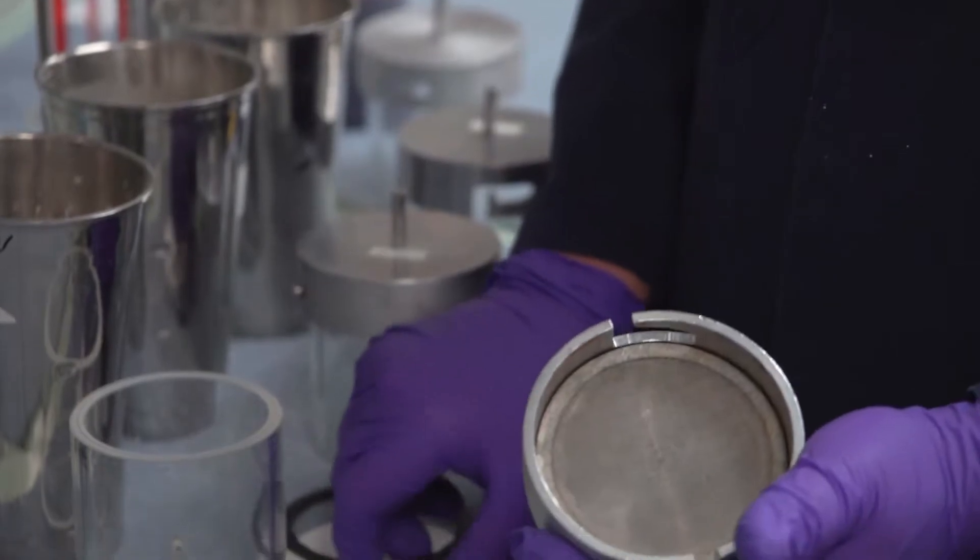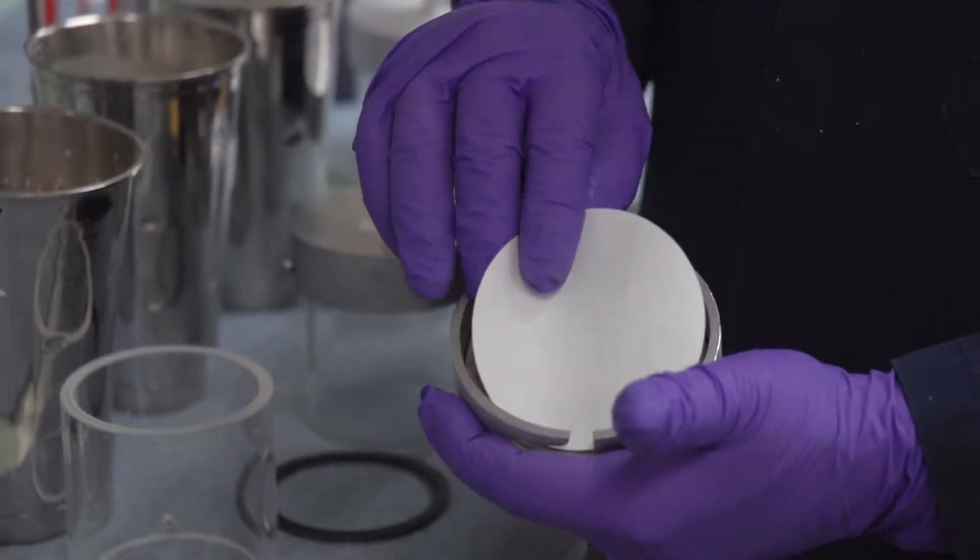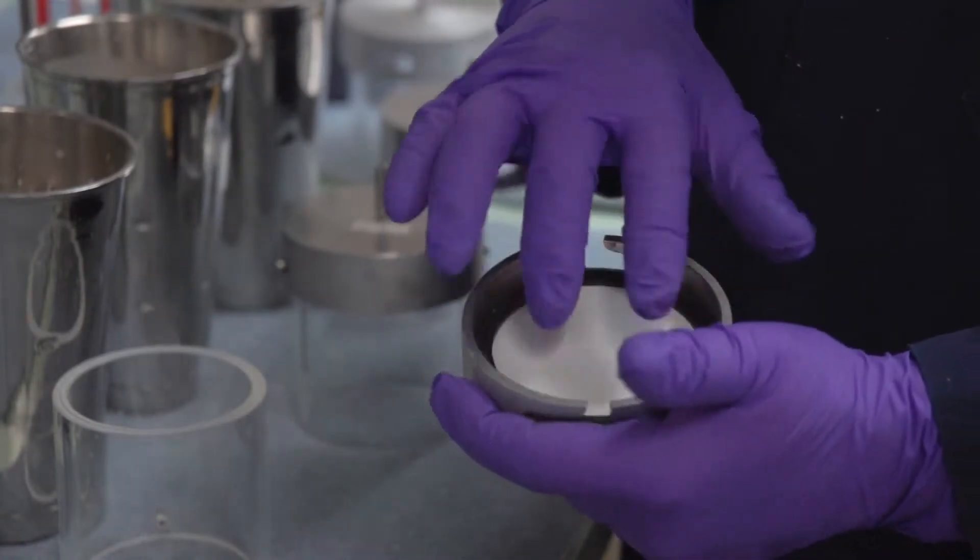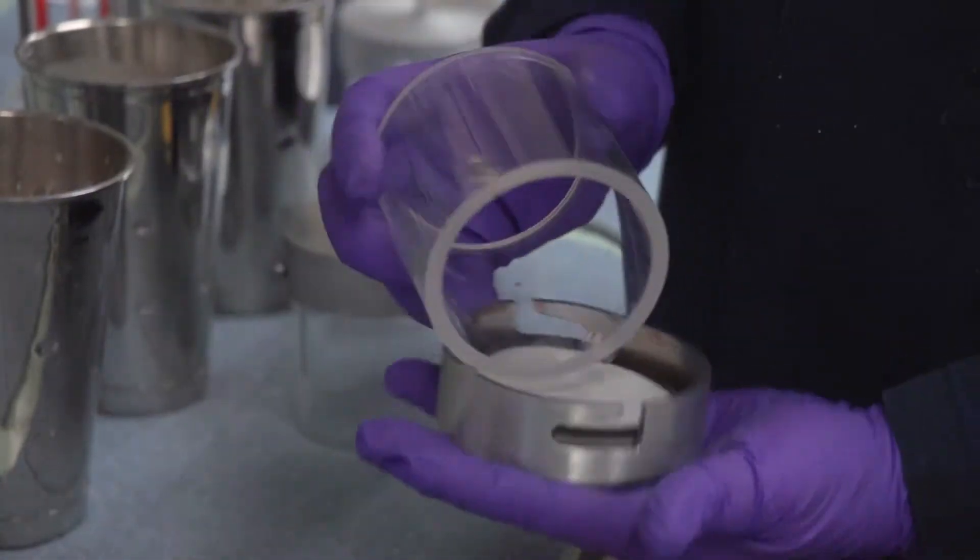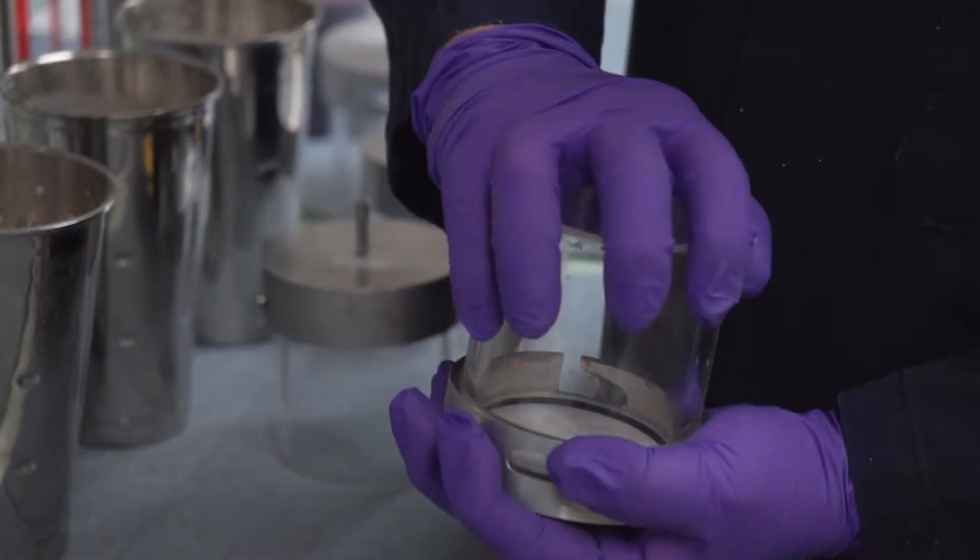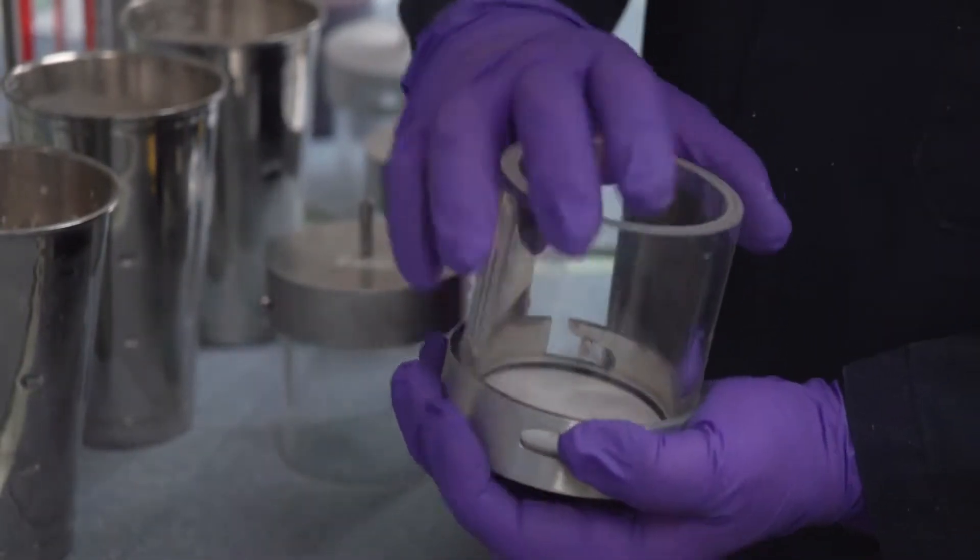I have my backup screen, the standard API filter paper, 2.7 microns, my gasket, and in this case we're substituting a plexiglass container for the standard cell.